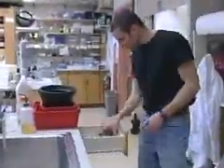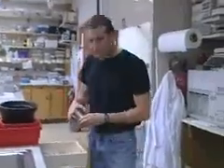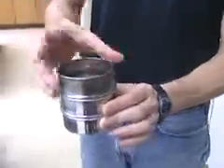We get 60,000 fly heads. We get the heads in this little apparatus here. We place the flies on liquid nitrogen, and then we shake them in a tube, and the heads fall off, the wings fall off, the legs fall off, and then this is also frozen, and we pour the flies in there.